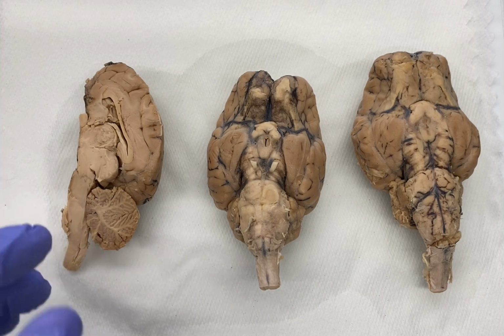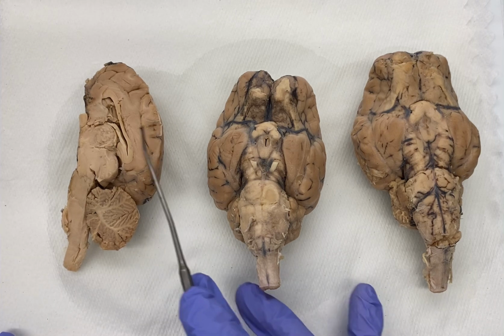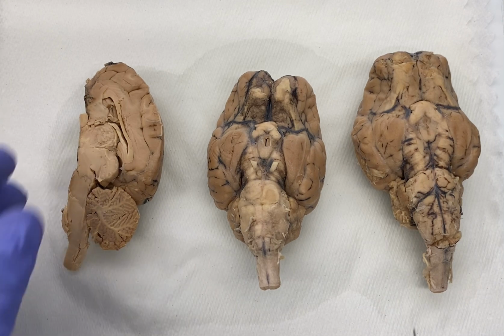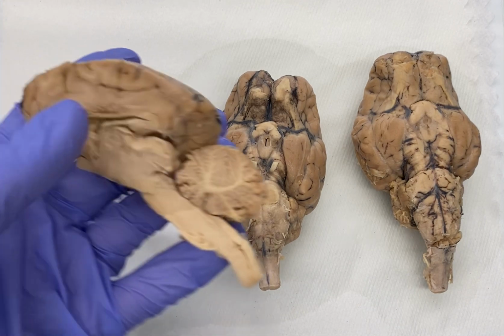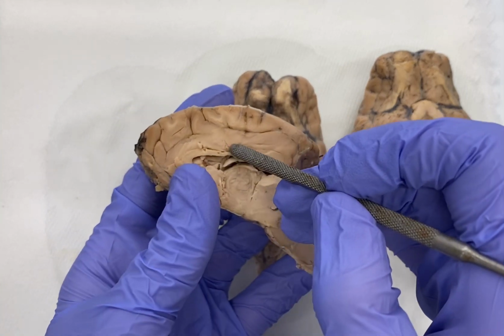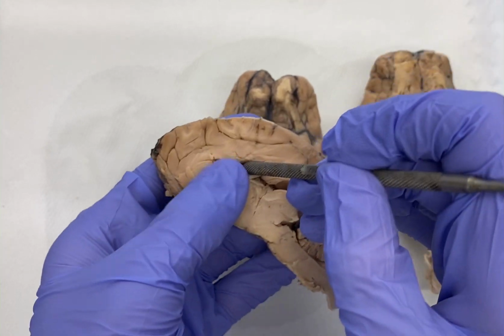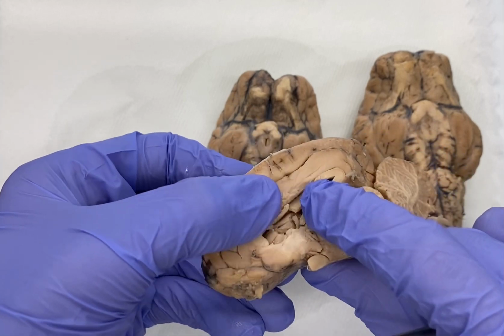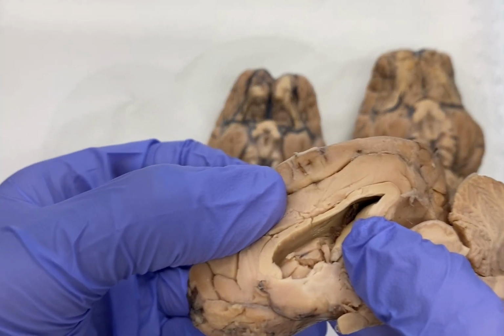the brain, right? So I'm going to show you the location of the ventricles on our sheep brain and our human brain, and then I'm going to show you a model of the ventricles, which may help it make a little bit more sense. What these ventricles are, they are cavities, these openings in our brain. If we look at this sagittally sectioned brain, toward the middle, in this inner region, you notice this big cavity. You can stick the pointer or your finger down in there. It's this deep cavity way in here.